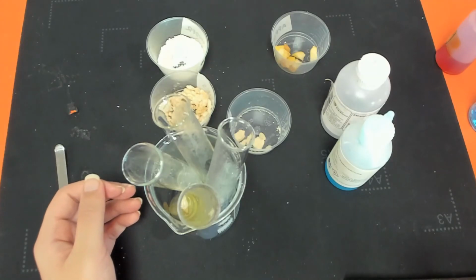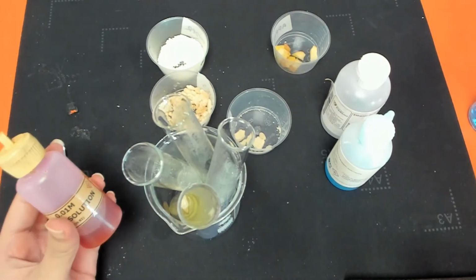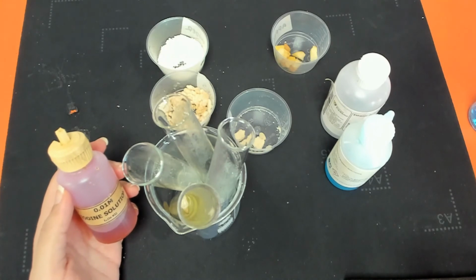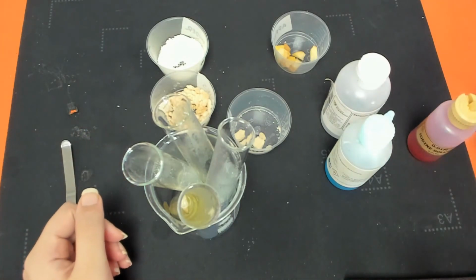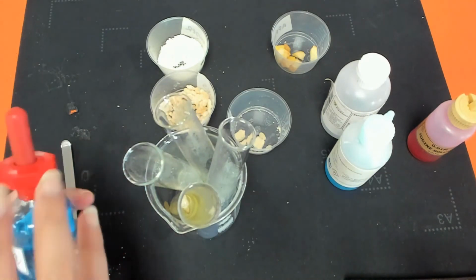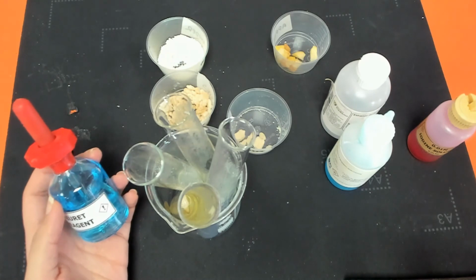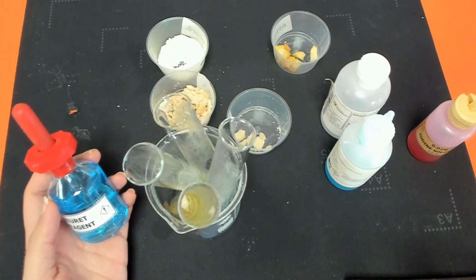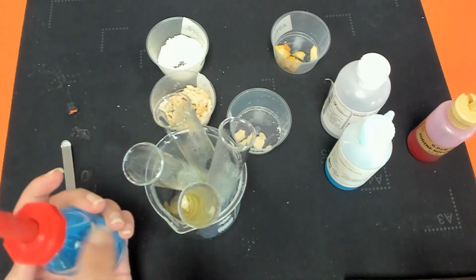So going back to the summary, we've looked at iodine. So iodine is a reagent for starch presence. So if starch is present, we'll see a colour change of blue-black. Next, we have got our biuret. So biuret is for proteins. So if we do have proteins in the food sample, then you should normally see a colour change to a pale purplish colour.